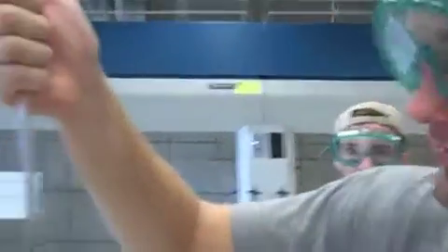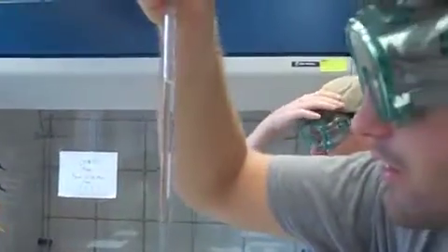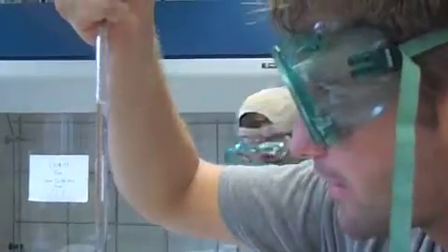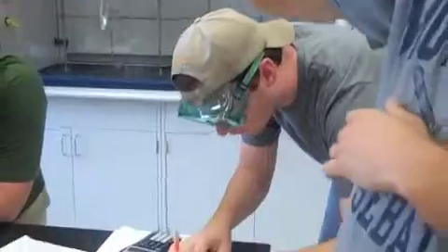We pulled out 8 milliliters of water. Meniscus is right under the 8 at eye level. So at the bottom of this, you get exactly how many milliliters? From the bottom, it's 8.8 milliliters of water. 8.80? Yes.